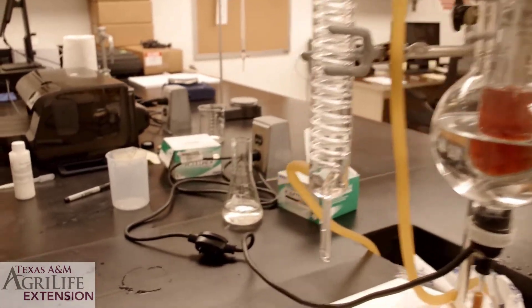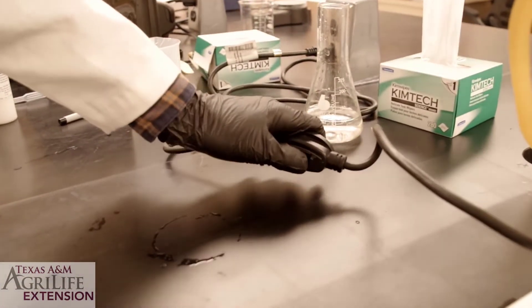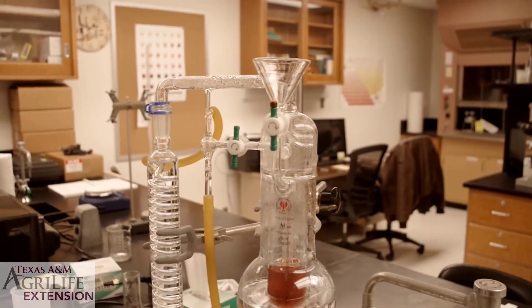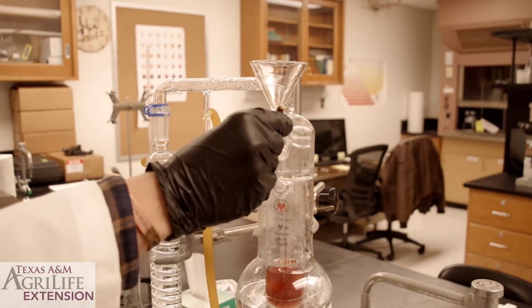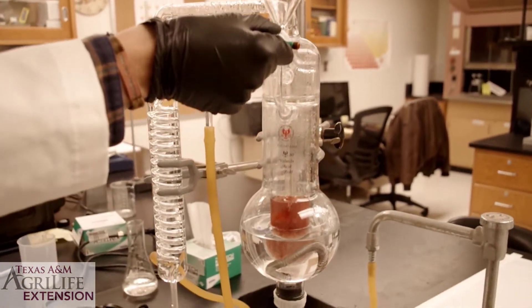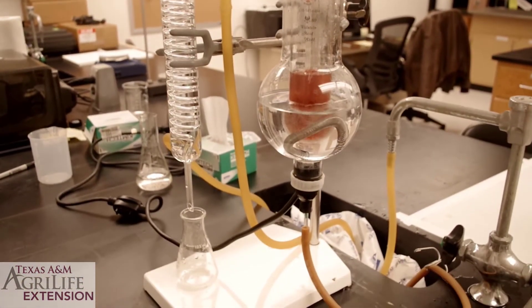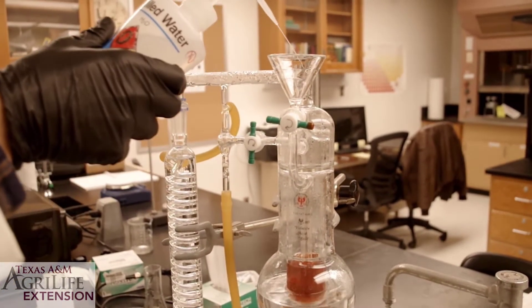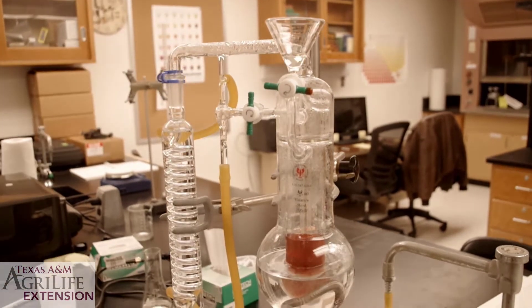You are now ready to turn on your apparatus. Make sure the stopcock is in the closed position. Ensure your system is closed by adding some distilled water to your funnel.